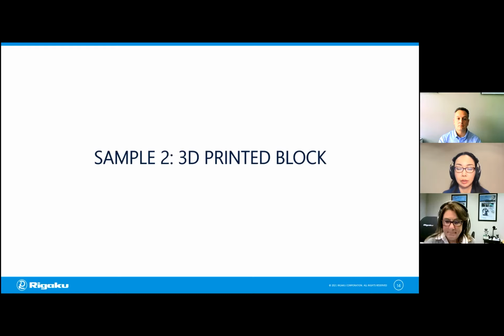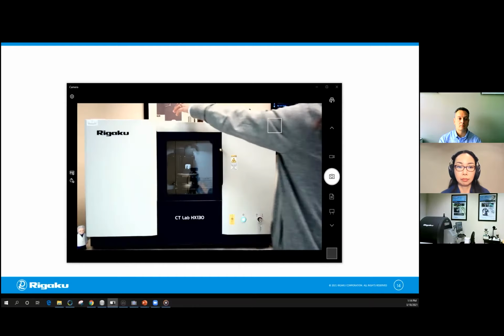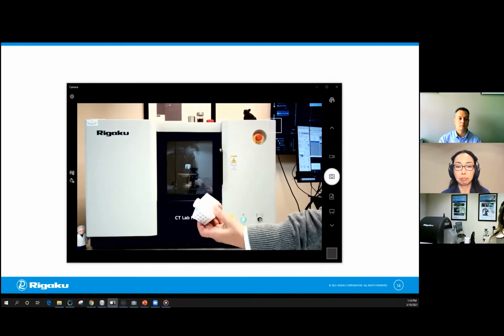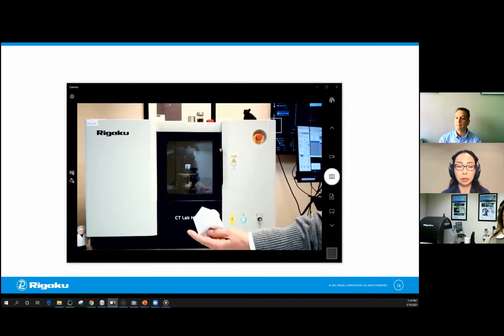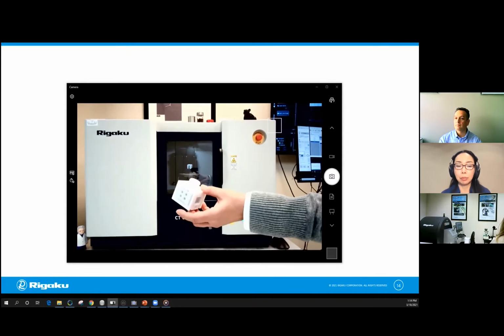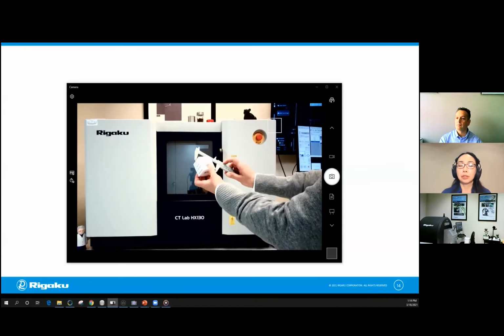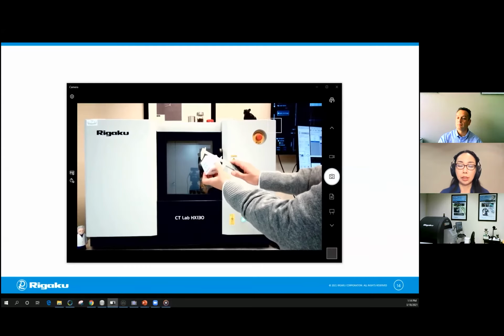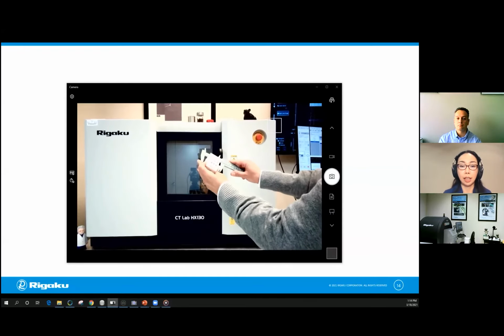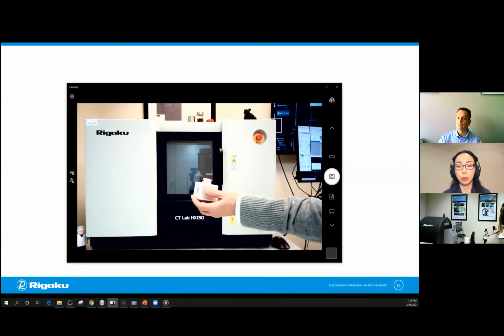Okay, let's switch to the camera so that we can look at the sample. There we go. Thank you. And I am just going to grab that sample, which is 3D printed plastic. It's about 2 inches wide, cube shaped roughly. So this is a kind of box or cube shaped plastic sample. And the next question I'm going to ask you is, which orientation will result in the best image? You can just, without thinking about it, put this cube shaped sample on the stage, either horizontally, vertically, or maybe you can tilt it. Which one would work the best?